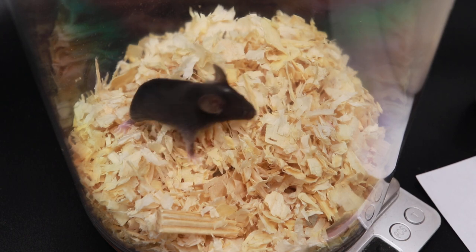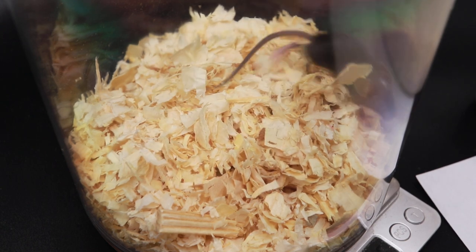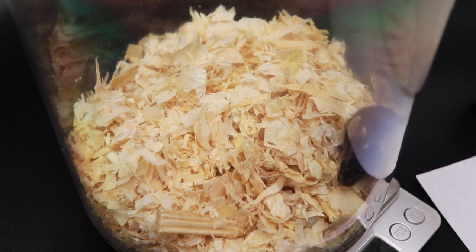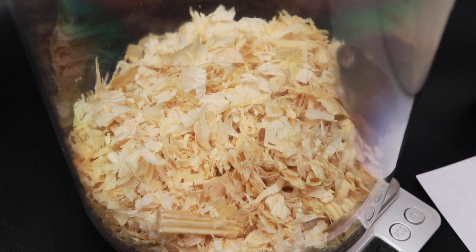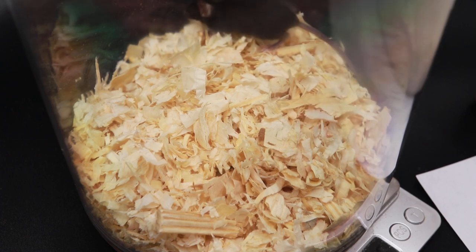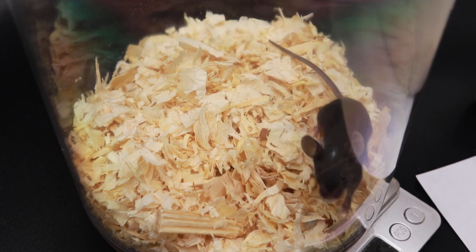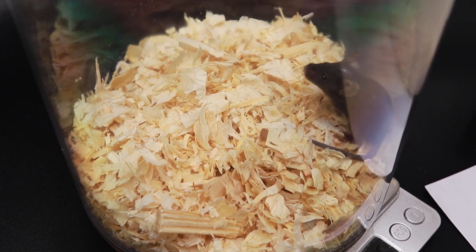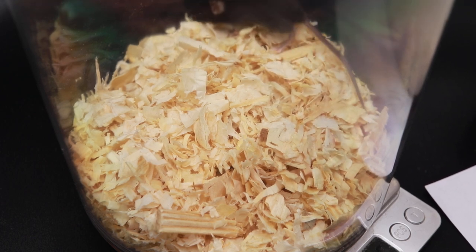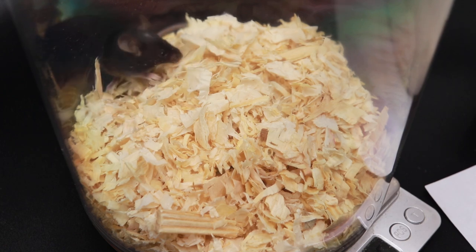So that's one. I should probably get something for a size reference — I didn't think of that. Well, let's do this. I think that she's actually the smallest. She's 7.8 grams — it bounces around a little bit, but this is not hard science here. We're just kind of getting an idea for what they weigh.